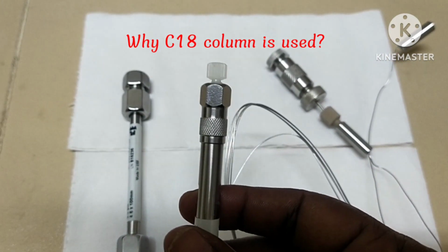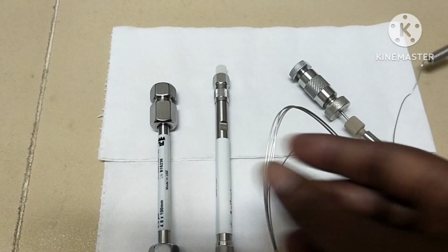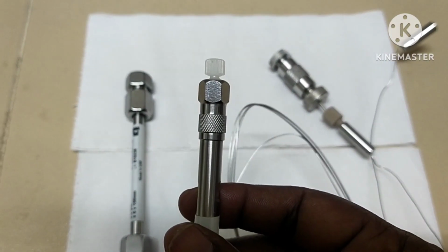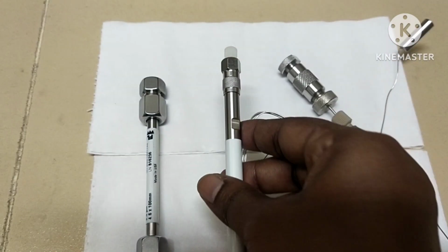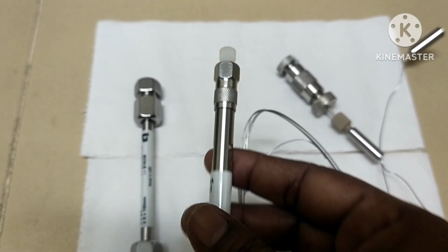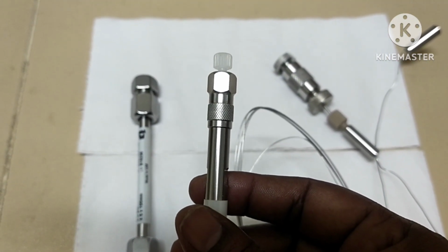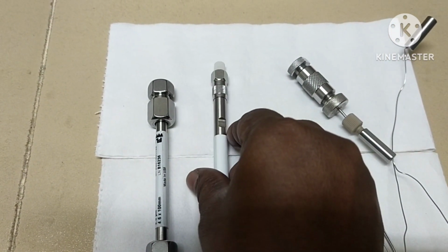Why is the C18 column used in HPLC? Because of the extra carbons, C18 has a large surface area that the mobile phase has to travel across. This offers more interaction time between the bonded phase and the eluates. Thus, the sample elutes more slowly and has more separation.